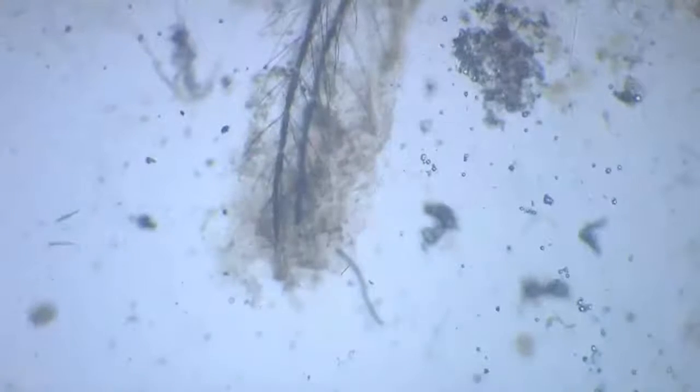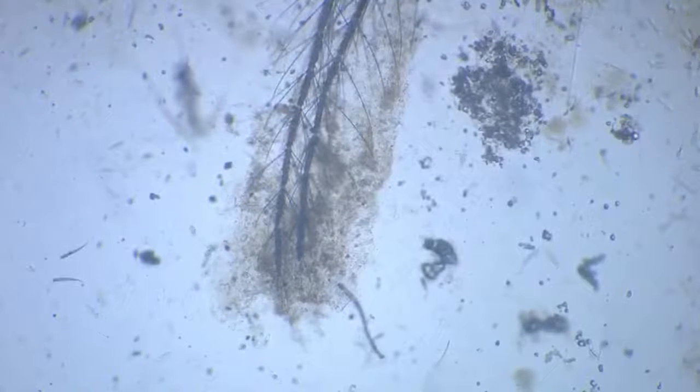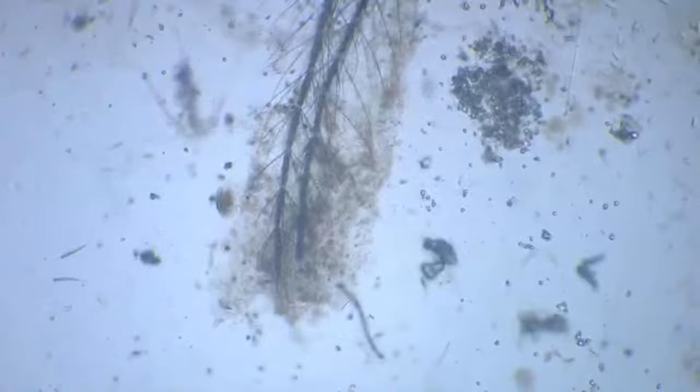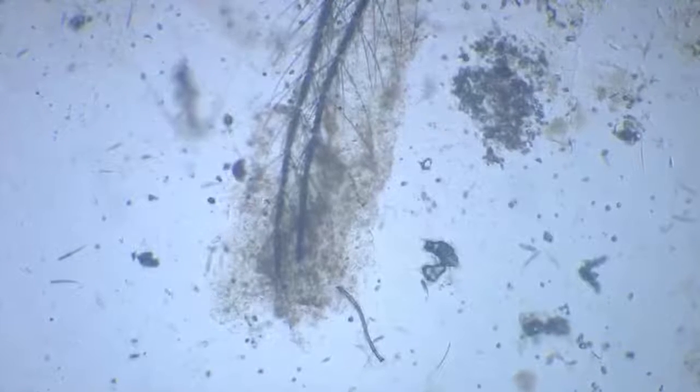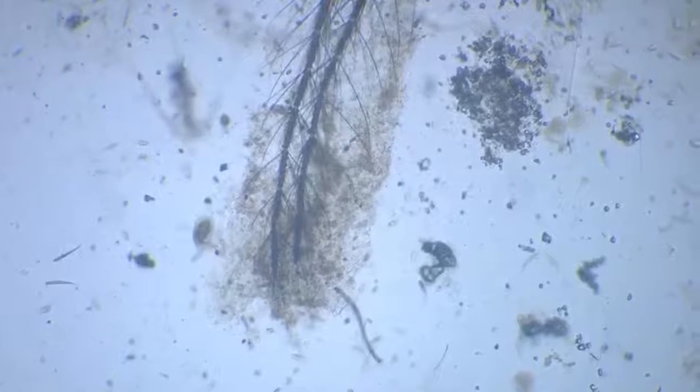So first we go towards the antenna, because the antenna are highly decaying. We see a lot of clustering of bacteria, and this was the organism that I'm talking about, this bigger one. We'll quickly zoom to a higher magnification.